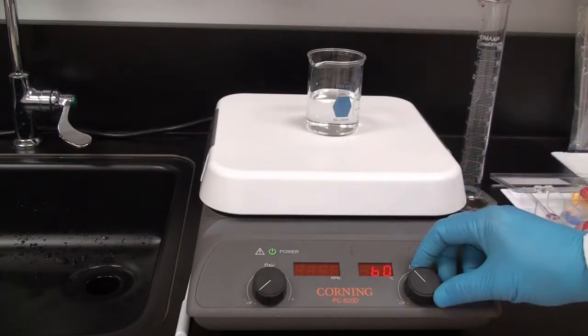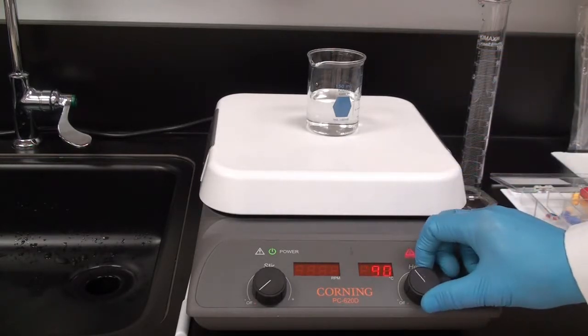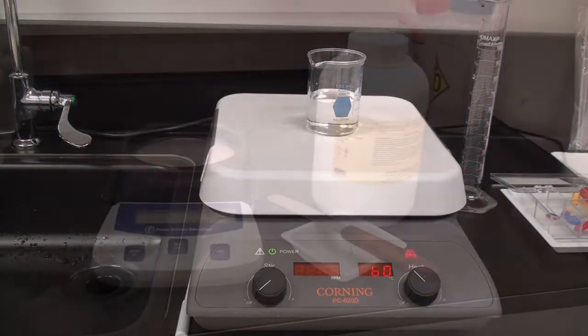So I'm going to heat it up to 60 degrees. You can turn it up higher to warm it up faster, but I have other things to do, so I'm just going to leave it at 60 degrees. That should take us only about 15 minutes for it to warm up.